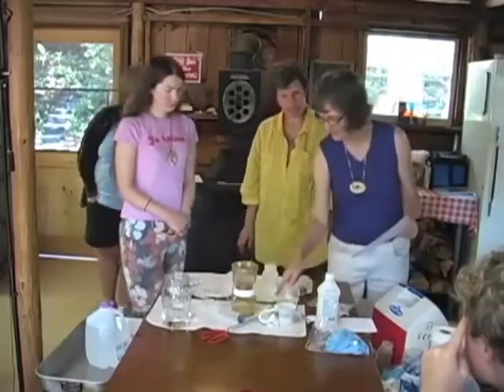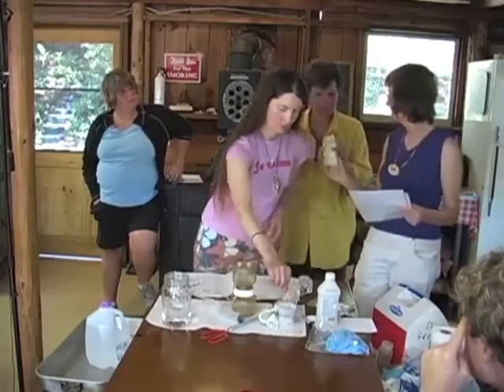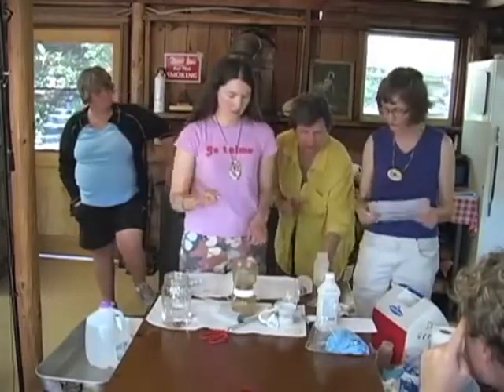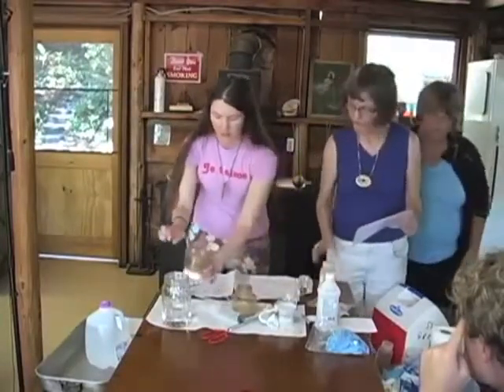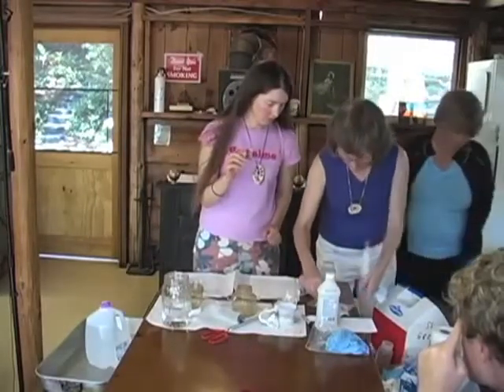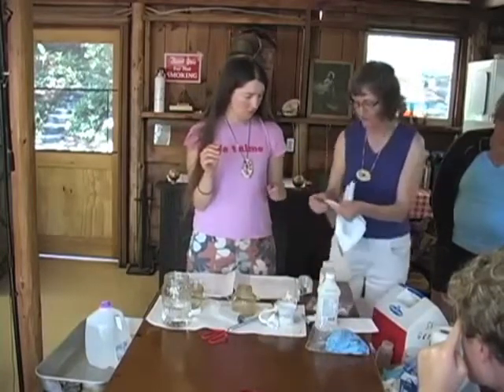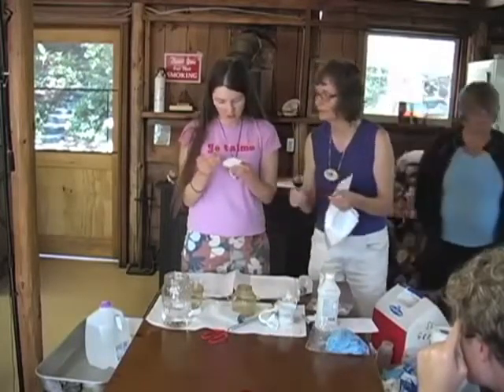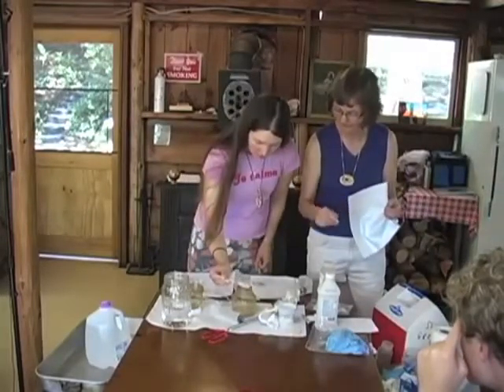All right, now you're going to sanitize one of these in alcohol, and you can shake the sample really well. Do I wash my hands after this? You might wait and dry it out a little. I'll just wash my hands. Okay, I'll shake the sample. You have to shake it up, and you sanitized already, unscrew, place a sterile filter. It's got a cover on both sides of it. Yeah, it's in the middle. See how easy she did that? Look at her. Yay! Technician.